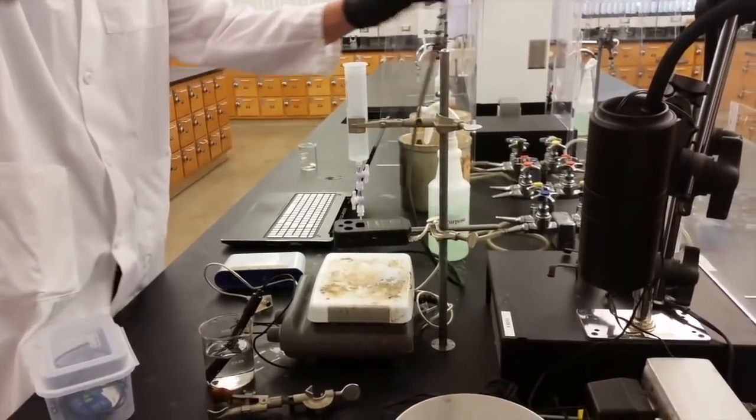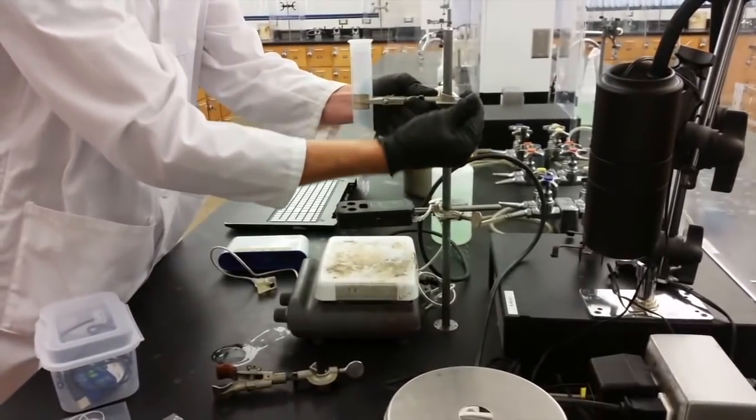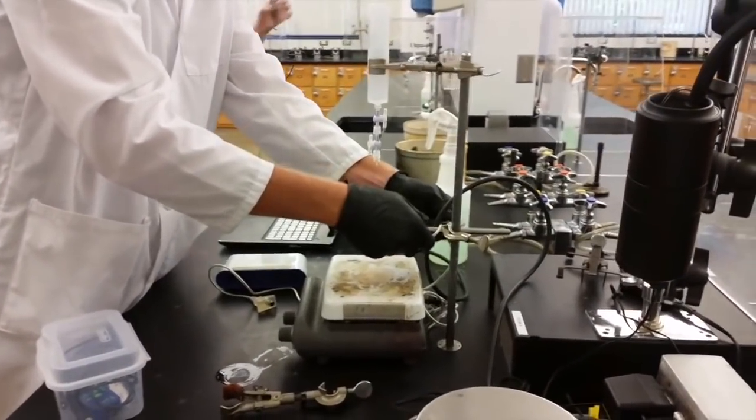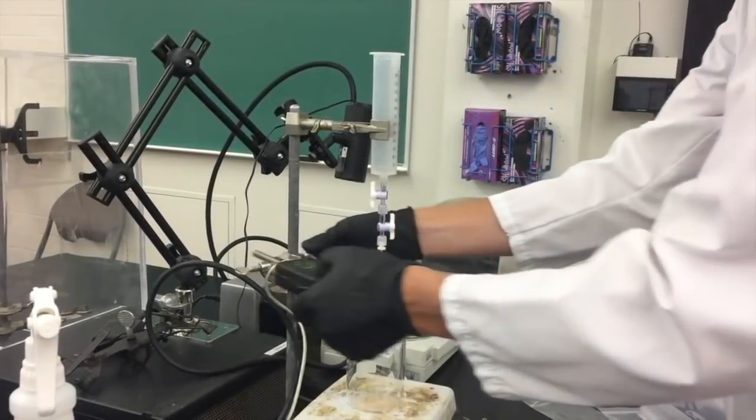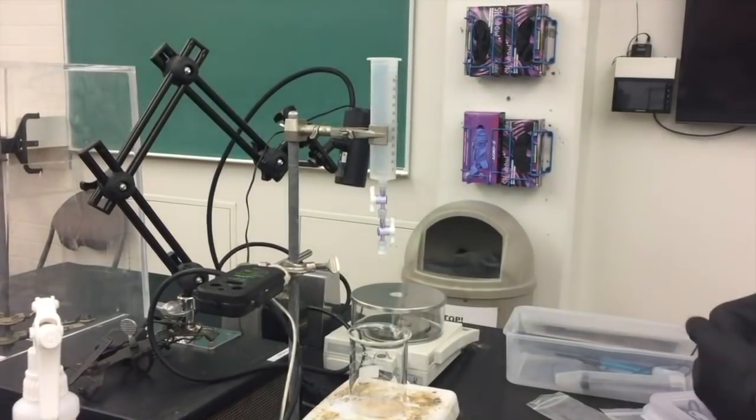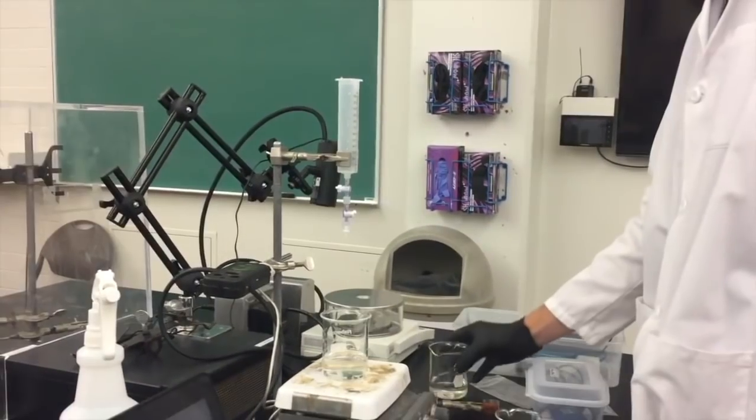Now you'll place a stir plate right in front of the ring stand and underneath the drop dispenser and counter. You'll have to rinse out the drop dispenser with distilled water. To make this easier you can adjust the utility clamp so that the drop dispenser swings off to the side like this.